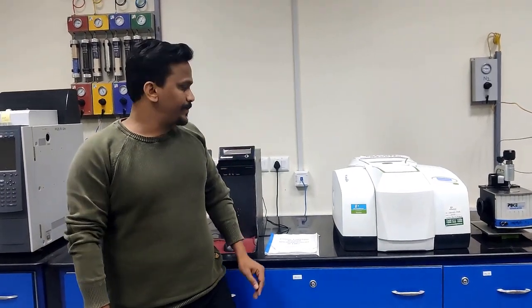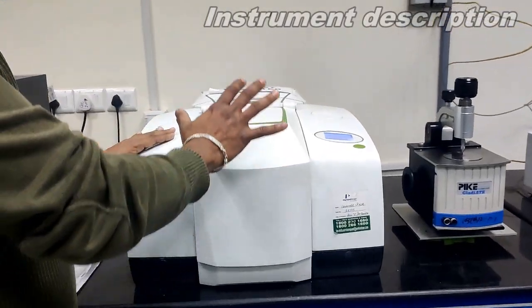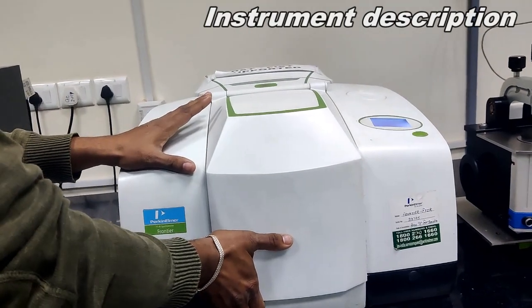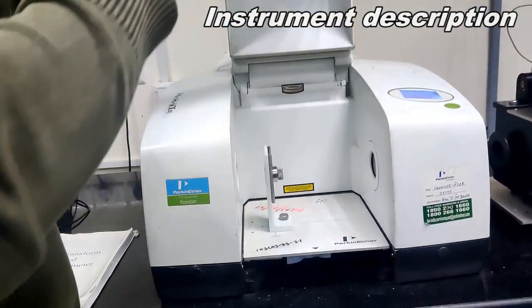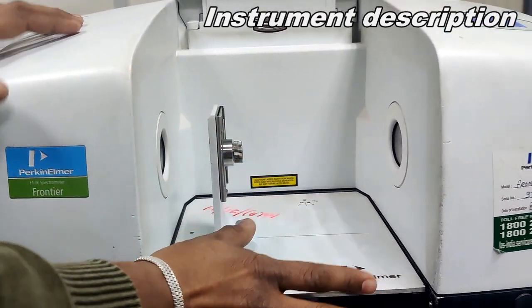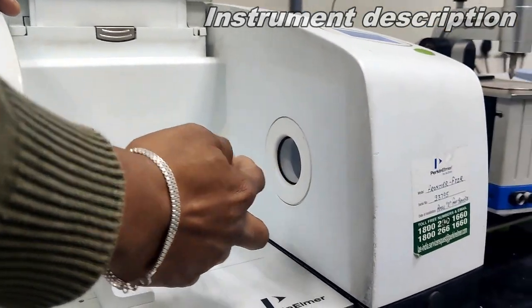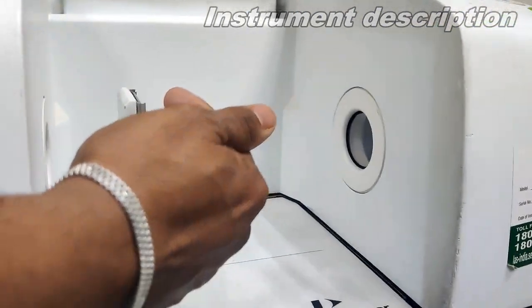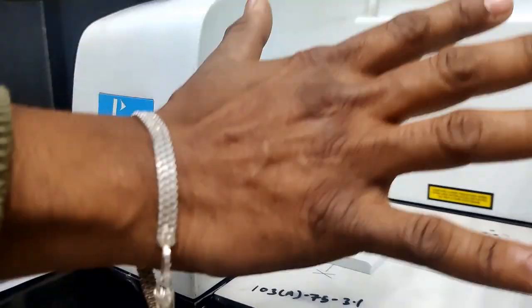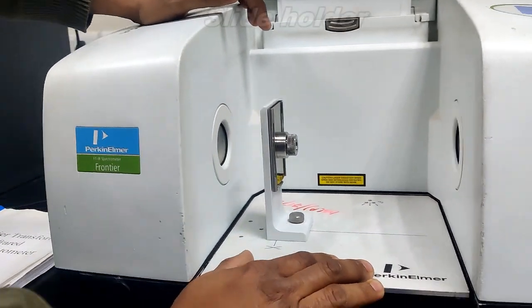So coming to instrument setup, this is the FTIR instrument, the main instrument. Here this is called the FTIR cover. If you lift up this cover, it lifts vertically. Here it looks like this is the actual setup, where IR rays come from this side, fall on the sample, and go to the detector. This is inside the part, and this complete setup is called the FTIR slide holder.